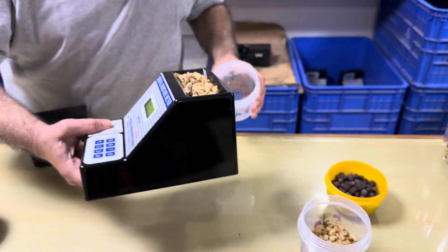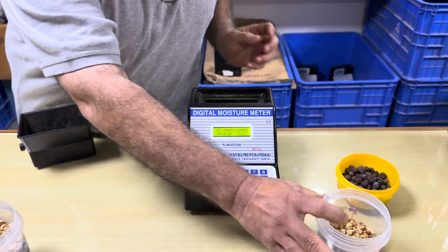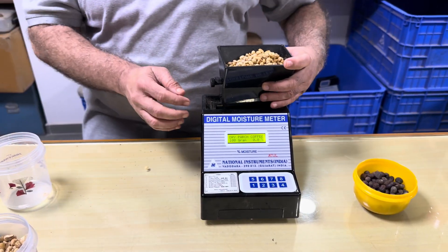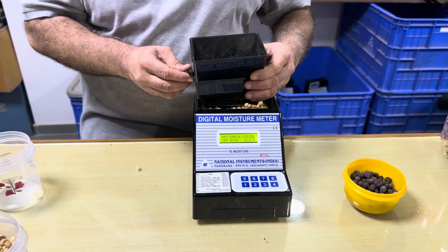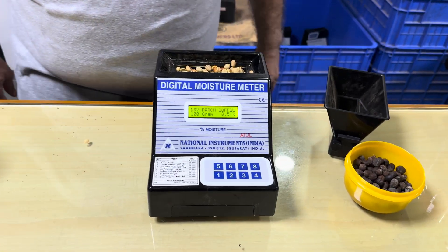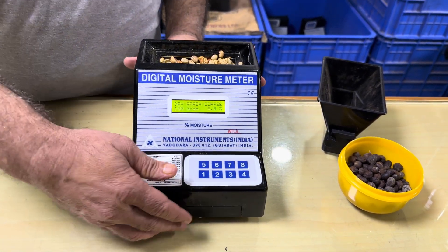Now I will remove this sample and take another. This is a Robusta sample — a dry parchment coffee, Robusta type. You can see the moisture content is 8.5%. So here we have seen the parchment form of coffee moisture.